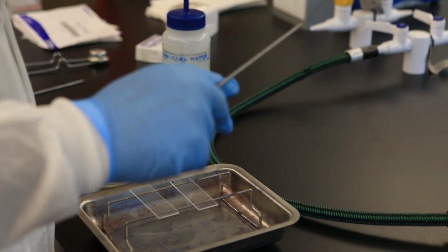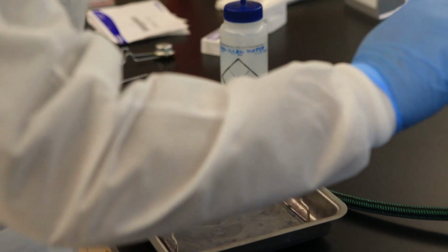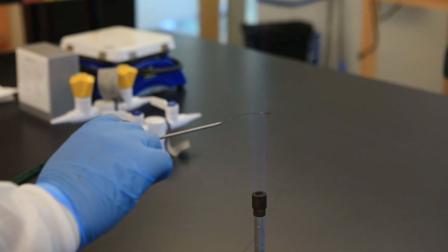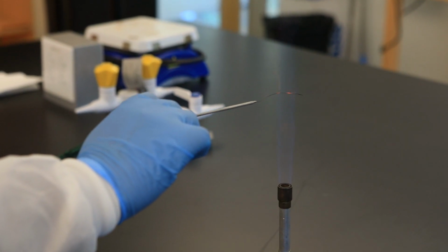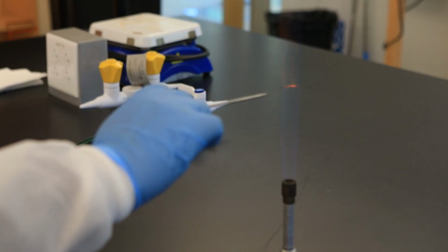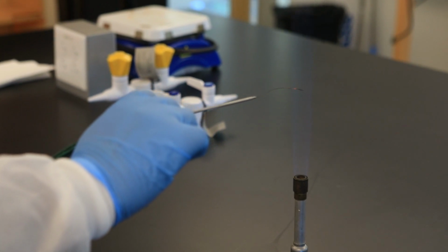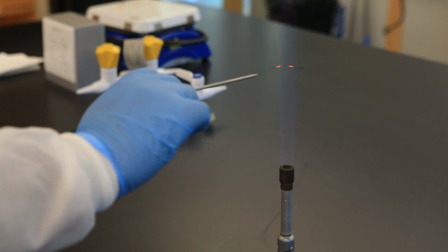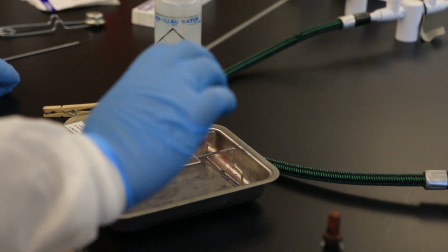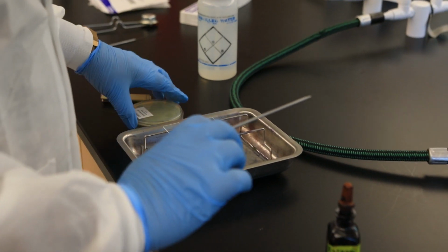Next, you're going to aseptically transfer the bacteria into the droplet of water. So I have to sterilize the inoculation loop, right? And proper sterilization is when you see that the wire in the loop turns orange, so it looks like it's glowing. Okay, so it's not about just sterilizing the loop itself, you have to sterilize the wire as well. Once I do that, I allow the inoculation loop to cool, remember, for about 30 seconds or so.